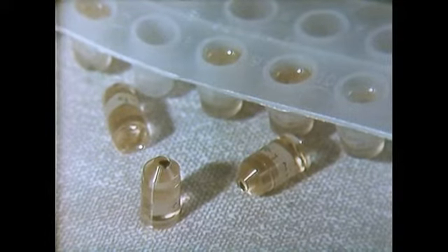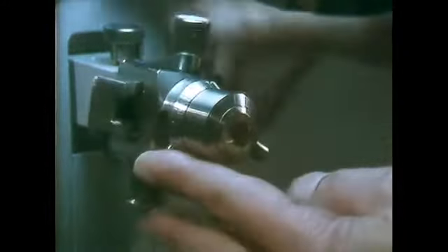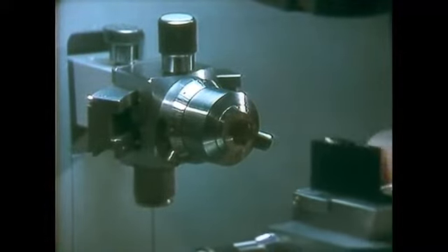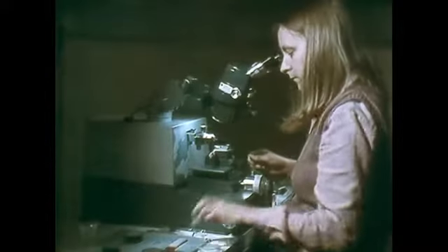Whereas in optical microscopy, sections about 10 microns thick are good enough, in electron microscopy, they need to be 200 times thinner, as electrons have such a low penetrating power, and these sections are cut on an ultramicrotome.